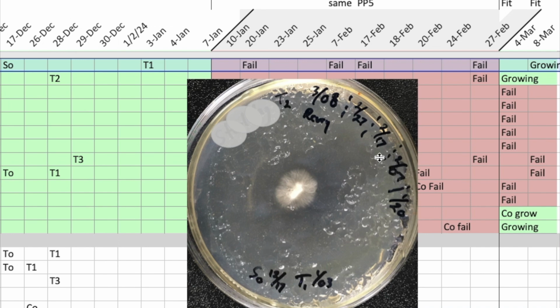So then I created a new batch of agar. I began to suspect, well, maybe it's the glass petri dishes, because those were new to me, but had been used previously, and maybe they had fungicide or something in them. So I went back to my screw top PP5 plastic dishes, and on the 17th that piece of agar was transferred, but still didn't grow either on the 17th or the 27th, failed both times.